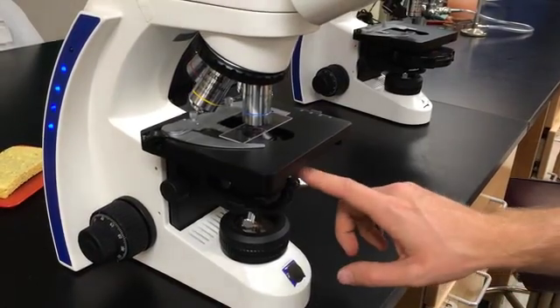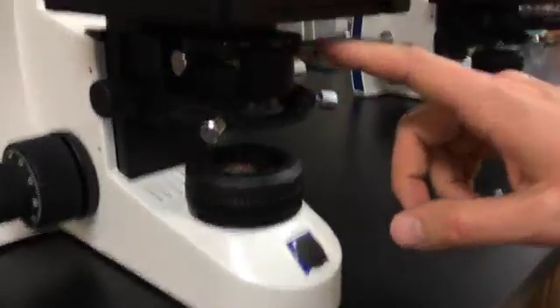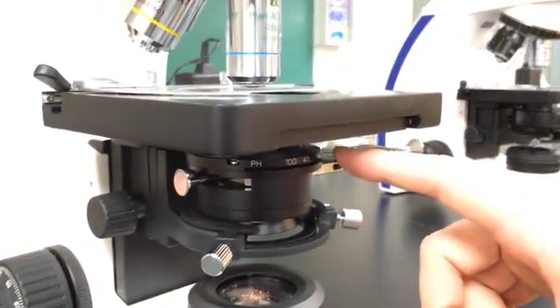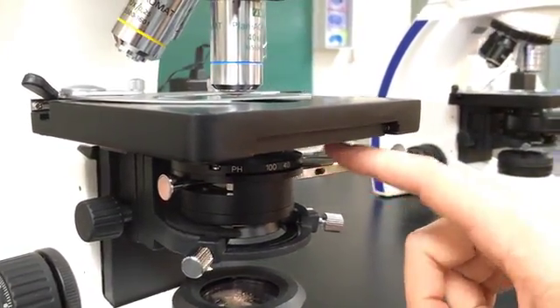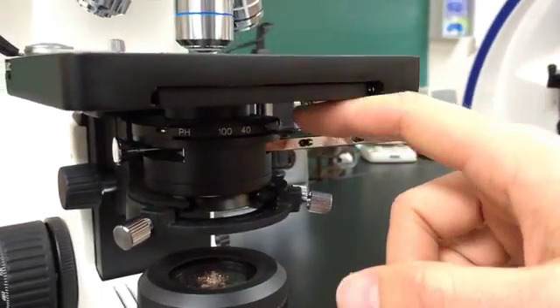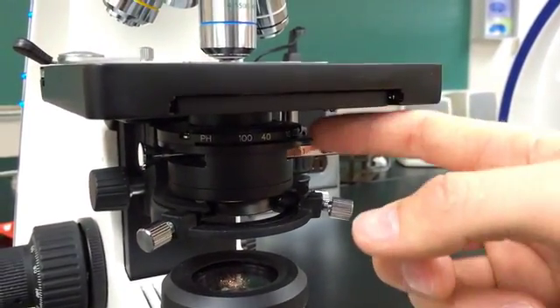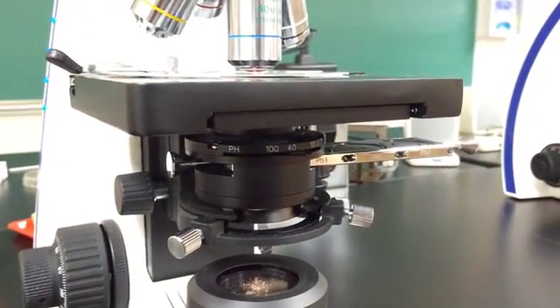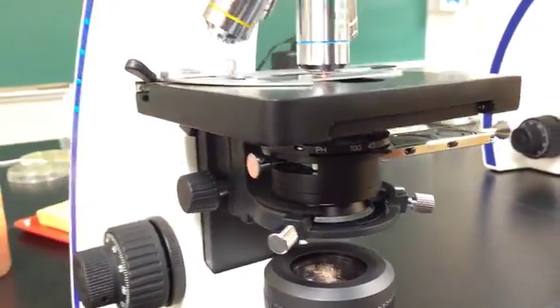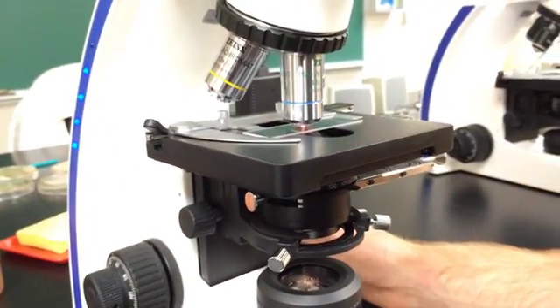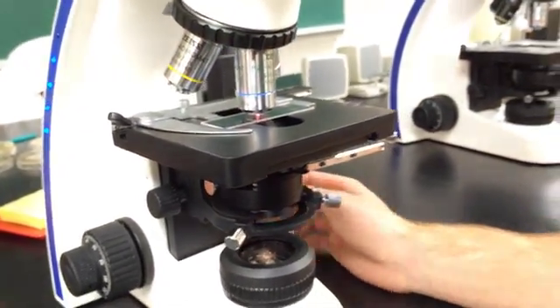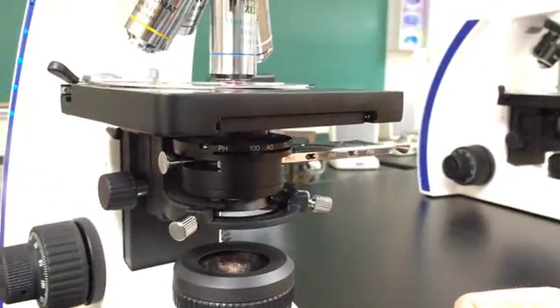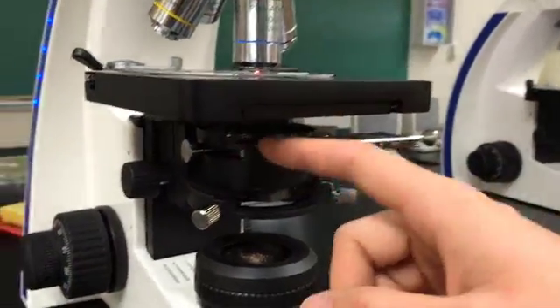Real quick, this little tab knob right down here, this, when I was using the 10x, it was all the way to the right underneath the 10. Now that I'm on the 40, I want to move it just so that it's under the 40. It'll allow more light to go through. I'm looking through, and yes, it does. It looks good. And again, if I was on the 100, I'd want it to be on the 100. And if I was using phase contrast, I'd want to move it all the way to the phase.